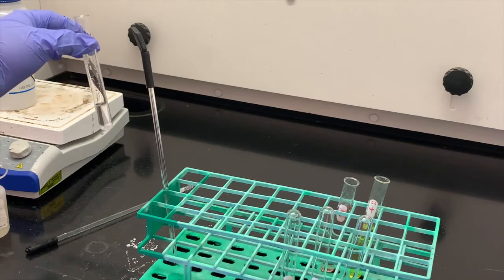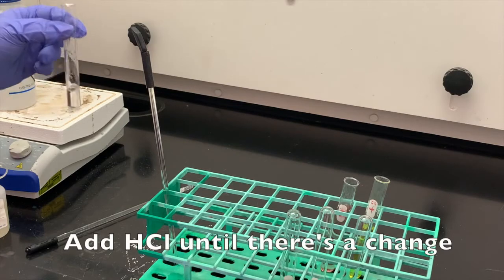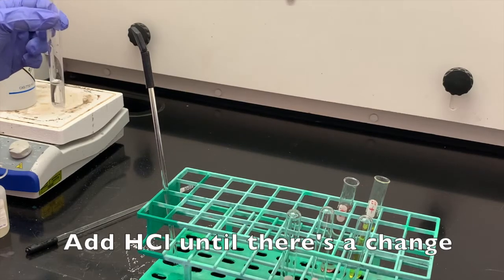Okay, and then we're going to add dropwise hydrochloric acid until we see some kind of change.